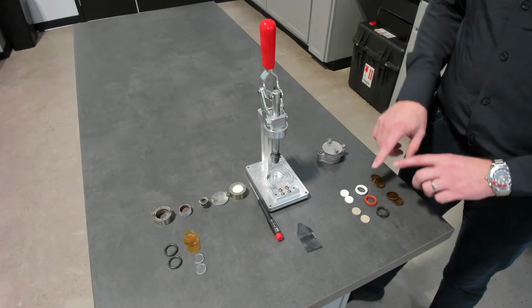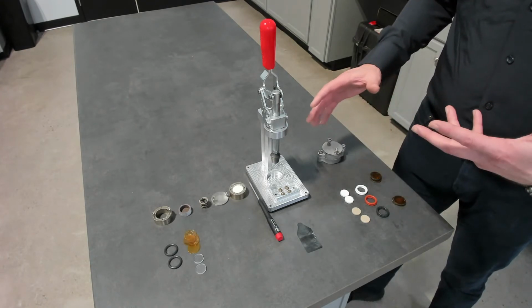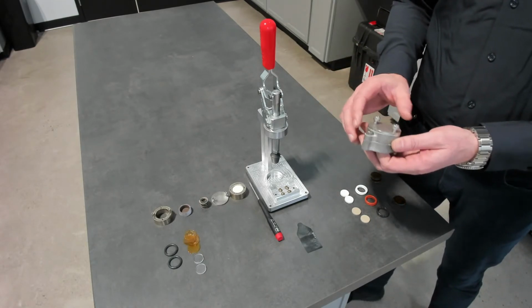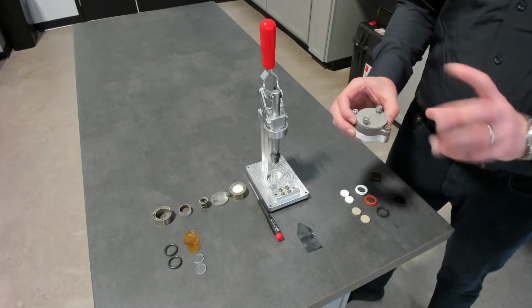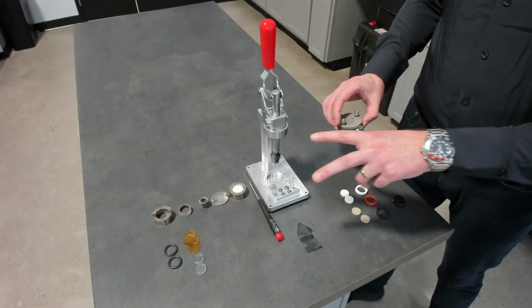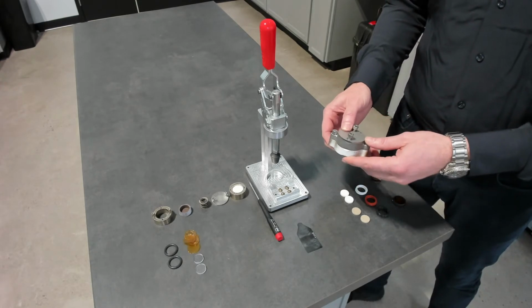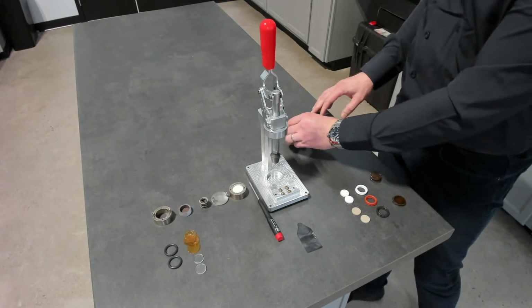So depending on the temperature range you require, those components are available. So this is a melt cell that we use in our ovens. It's not been optimized for the temperature platform. We'll show you that. We're actually going to show you the exact same setup with a simple polymer melt cell that's designed for the temperature platform, but this would be a melt cell designed for a standard furnace. So it's the setup exactly the same.